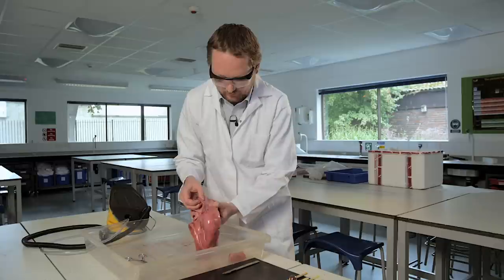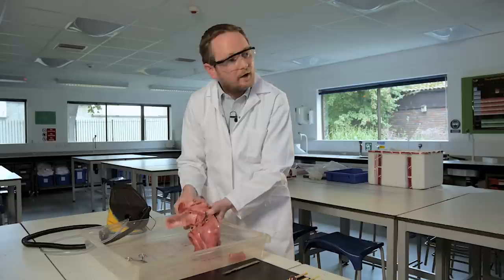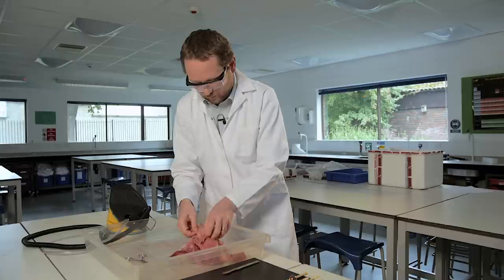One of the things that I think is very valuable to do is just to cut off a section of the lung and cut off a bit of the heart that you've got and pass those around and students can weigh up the differences. The lung tissue is really, really light. It's mainly air, which is what its purpose is, to create a surface between the air and the blood for gas exchange.